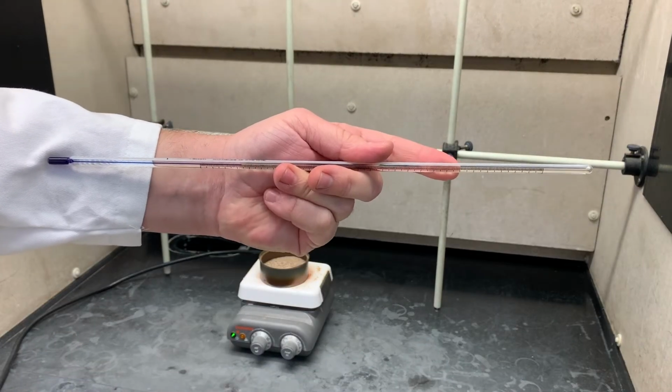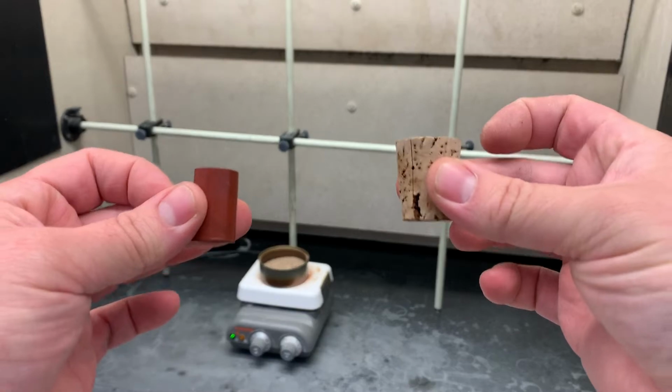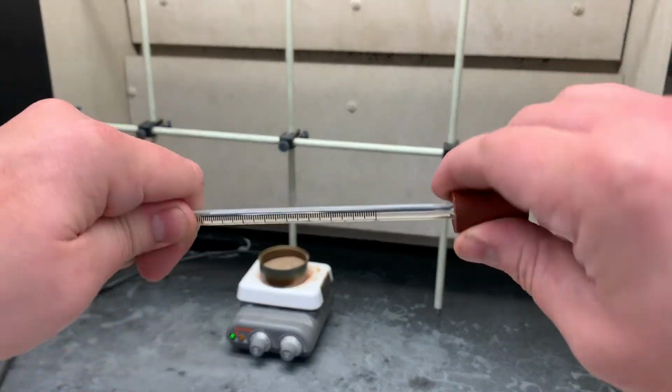So for today's reaction, we have to achieve quite a high temperature, so we have to start heating up now. I'm going to start off by taking one of the 2 thermometer adapters. We need one so we can firmly hold it in place without sliding too deep into the sand bath and giving us a false reading.